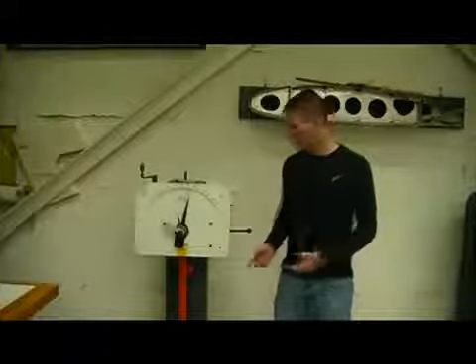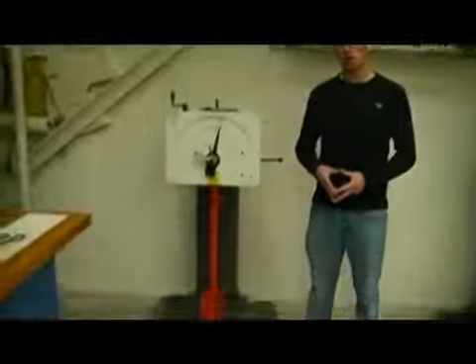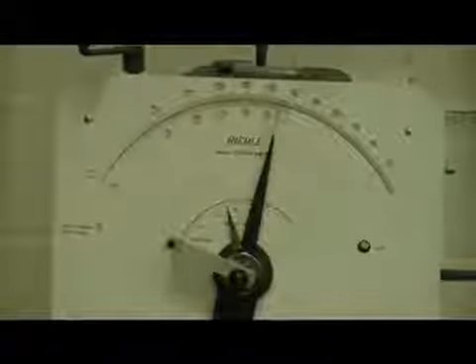This is the Charpy test machine. What makes this machine unique is twofold. First off, the samples will be held as a simply supported beam, and that is one of those external conditions I mentioned earlier, the geometry in which the sample is held. Next, we have the hammer of this machine. It is a 15-pound hammer. This hammer will be held from a height of 2 feet, which results in a total potential energy of 30 foot-pounds. Before we begin any sort of test, we have to make sure the machine and scale are zeroed.